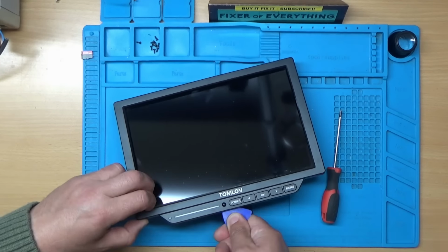And I guess that's the connector that goes to the actual camera on the microscope side. And that one just goes to the front panel here. So there's actually two front panels. I was just wondering what this connector was for that I've just unplugged. And that's for this little thing here, which is actually a little touch slider for adjusting the illumination LEDs on the camera.